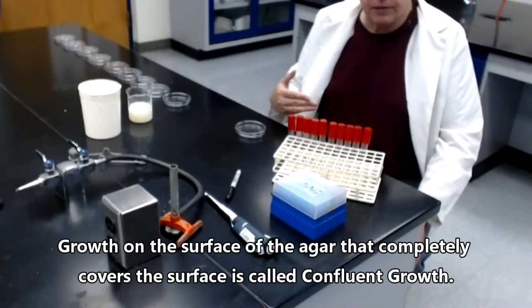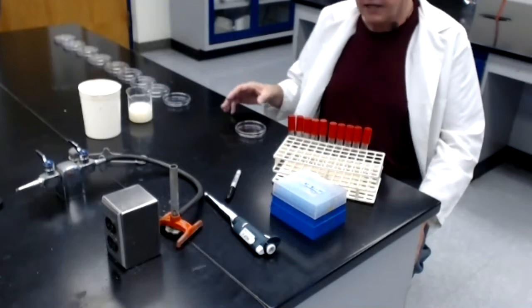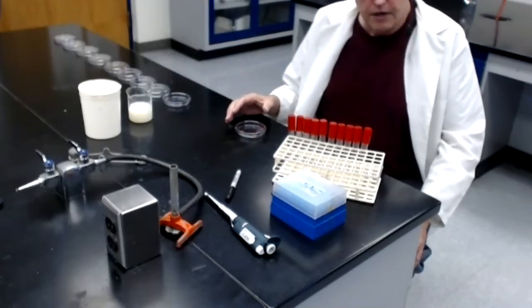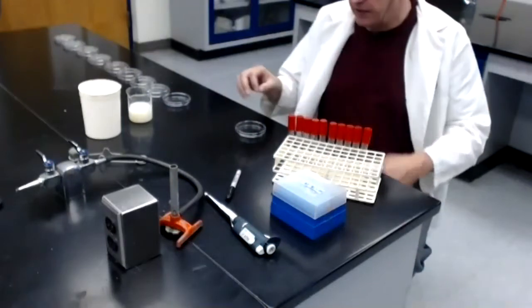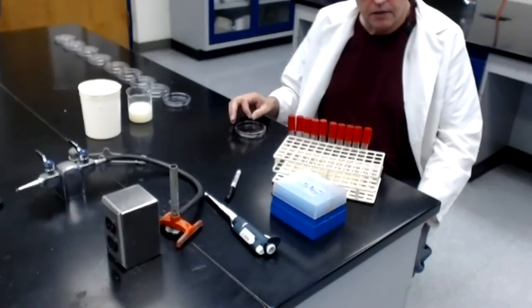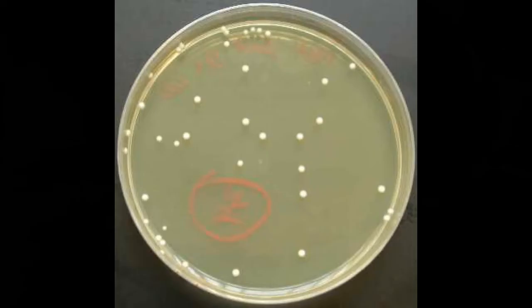That doesn't help us. We need to prepare our milk sample in such a way that when we do get it onto tryptic soy agar, the individual bacteria are so spread out that they form individual, isolated, easily counted colonies. Here is a TSA plate with about 34 or 35 isolated colonies growing on its surface. Each of those colonies contains bacteria that are all descended from one or two original bacteria that were placed on the surface of the agar at that position.